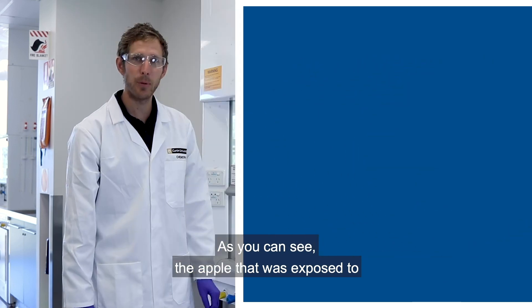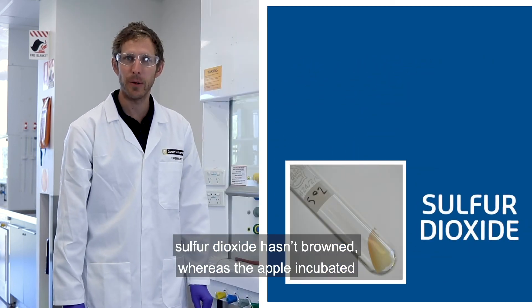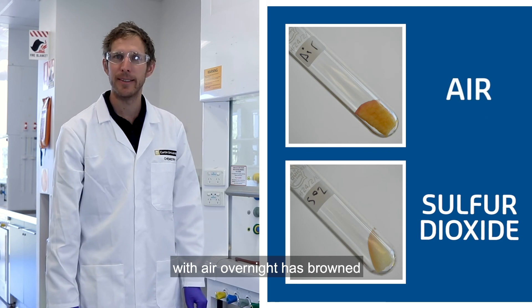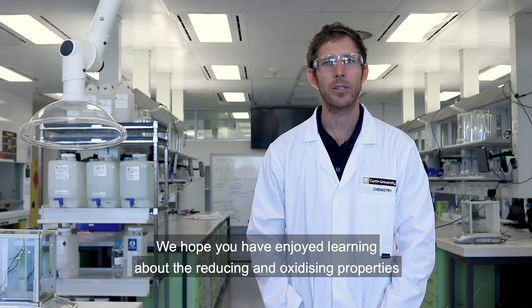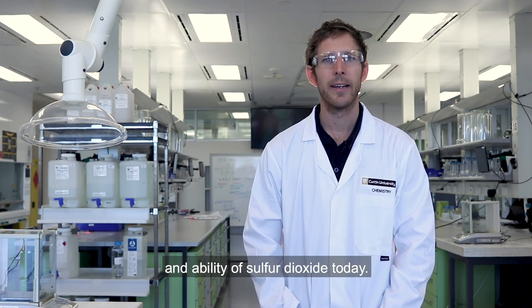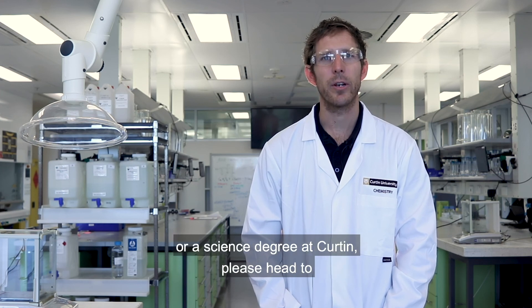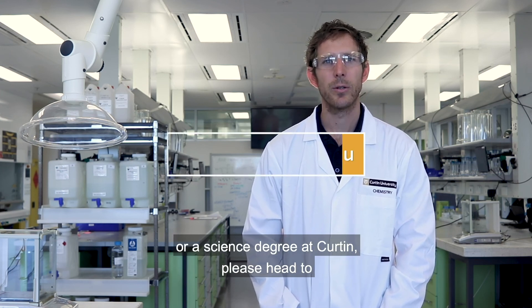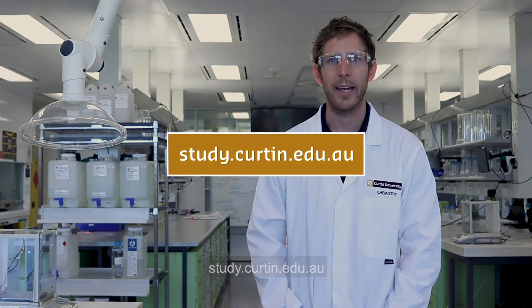As you can see, the apple that was exposed to sulfur dioxide hasn't browned, whereas the apple incubated with air overnight has browned. We hope you have enjoyed learning about the reducing and oxidizing properties of sulfur dioxide today. If you would like to find out more about studying chemistry or a science degree at Curtin, please head to study.curtin.edu.au.